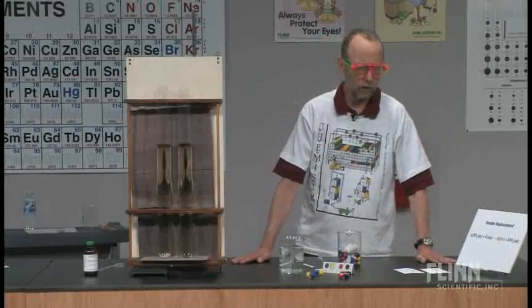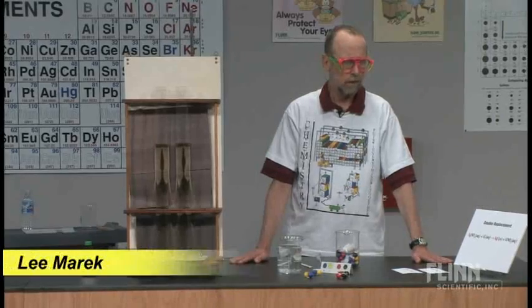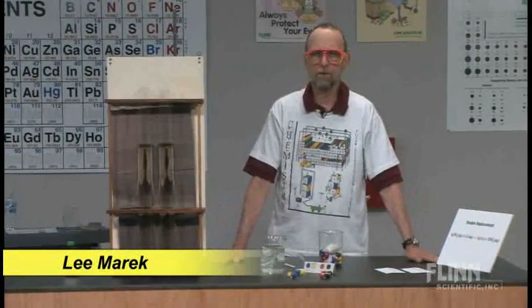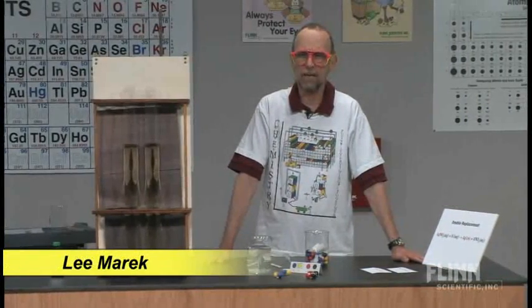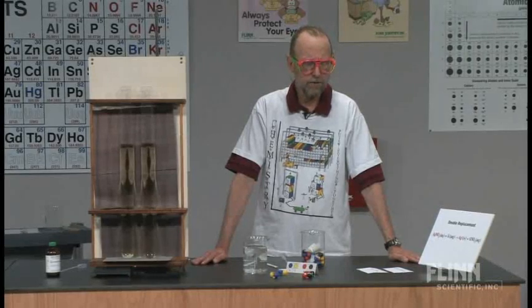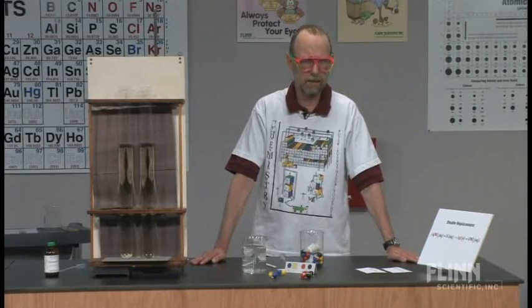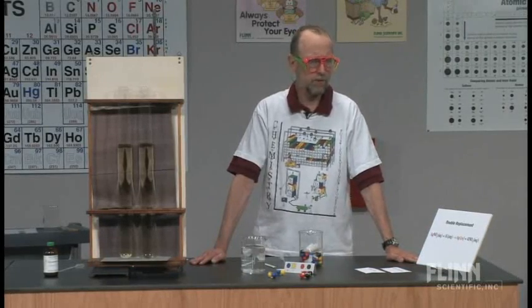Today we're going to take a look at a double replacement reaction. Many high school books talk about that as one of the four main types of reaction. I prefer to call it a precipitate reaction, that's much better because we're going to be forming a precipitate here.